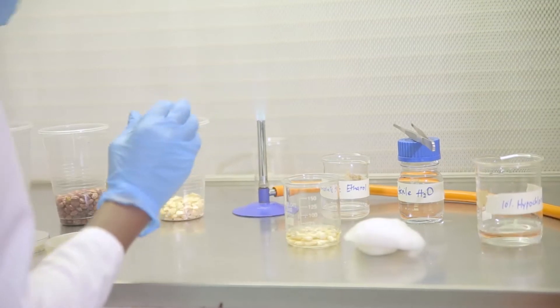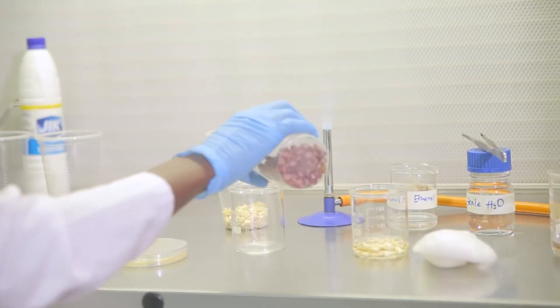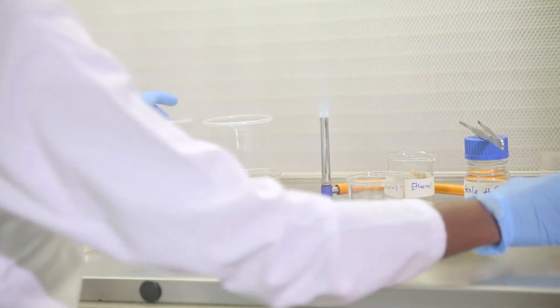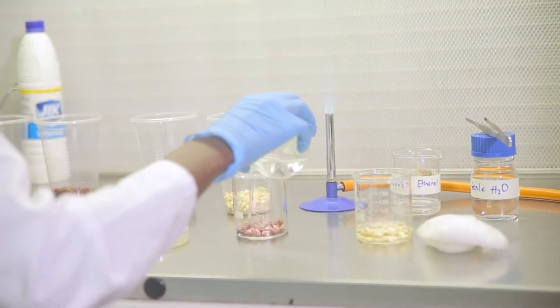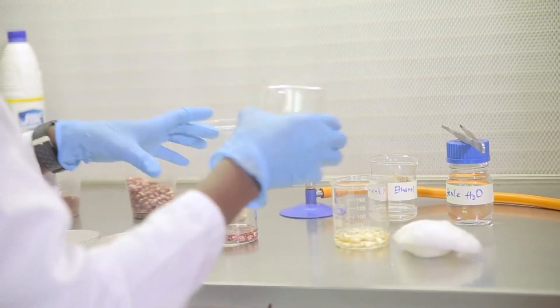So in the meantime I could work on the beans. I'll also put a few beans. I'm going to cover them with the hypochlorite solution, also for about a minute.